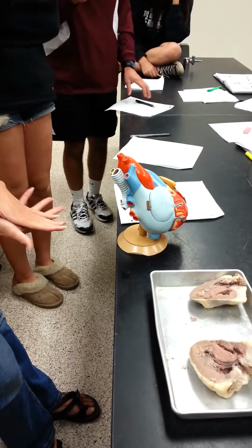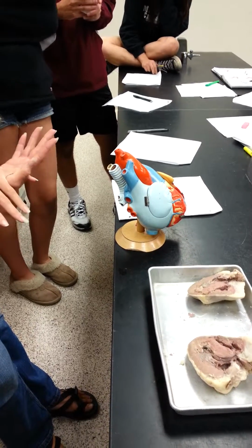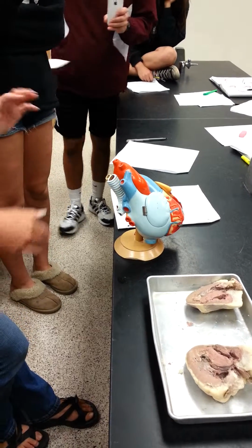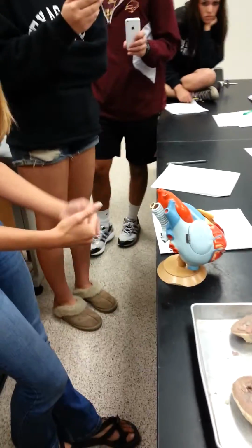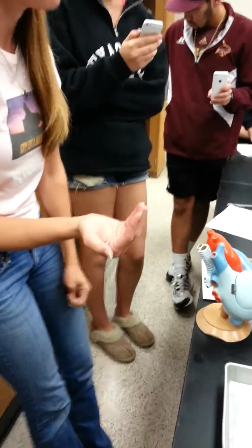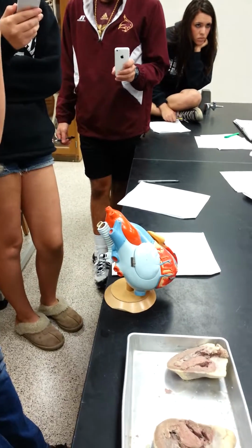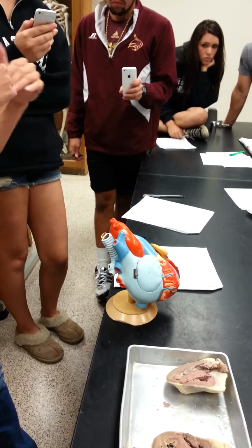So cool, that's the anterior interventricular sulcus. So that's like a nightmare term, right? But if you start breaking it down, it's really not too bad. Anterior means front, right? And then we learned sulcus a couple of weeks ago. Remember sulci and gyri? Sulci, you sulk in the valleys. So sulcus is, once again, a valley.